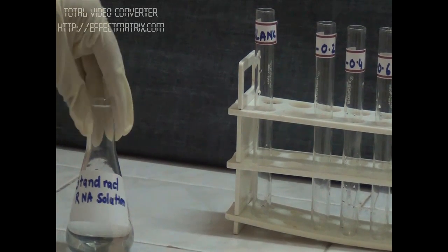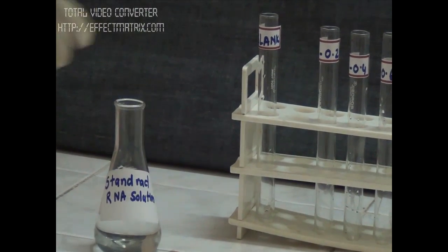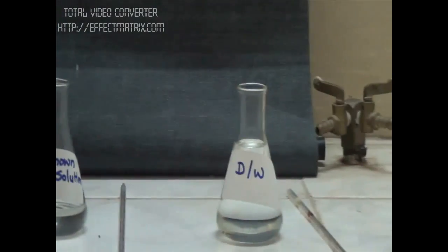Let's see how the experiment goes. First we are having the standard RNA solution, the unknown RNA solution, distilled water, and orcinol reagent.